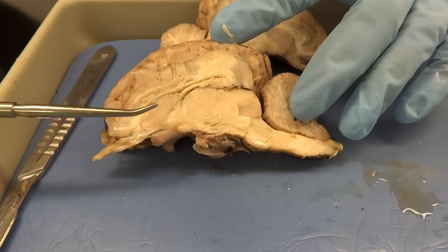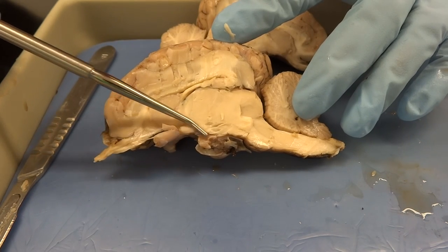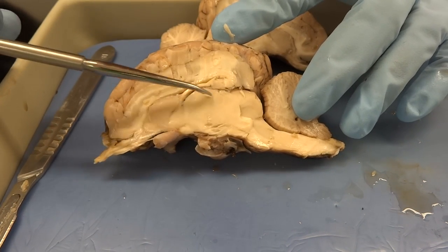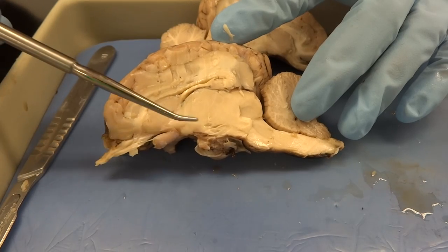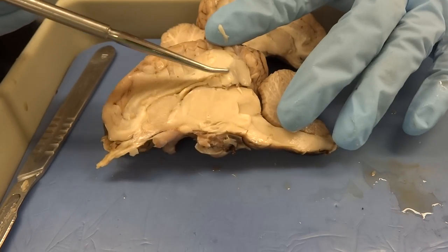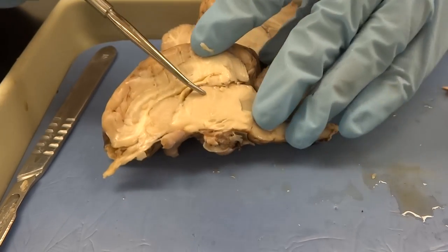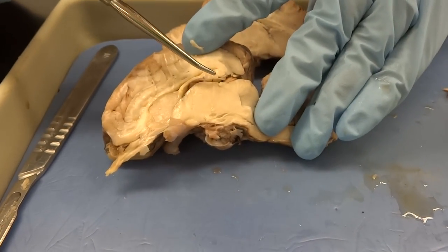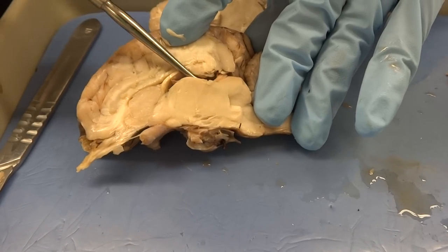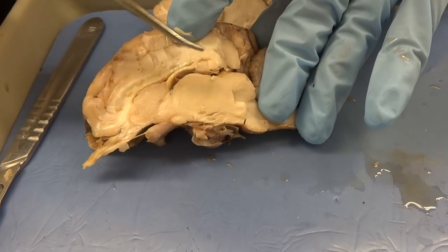From here we can see a pretty good shot of our entire diencephalon, including the thalamus, the hypothalamus, and the epithalamus, which also includes the pineal gland. It's kind of snug in there, but that's our pineal gland that makes melatonin.